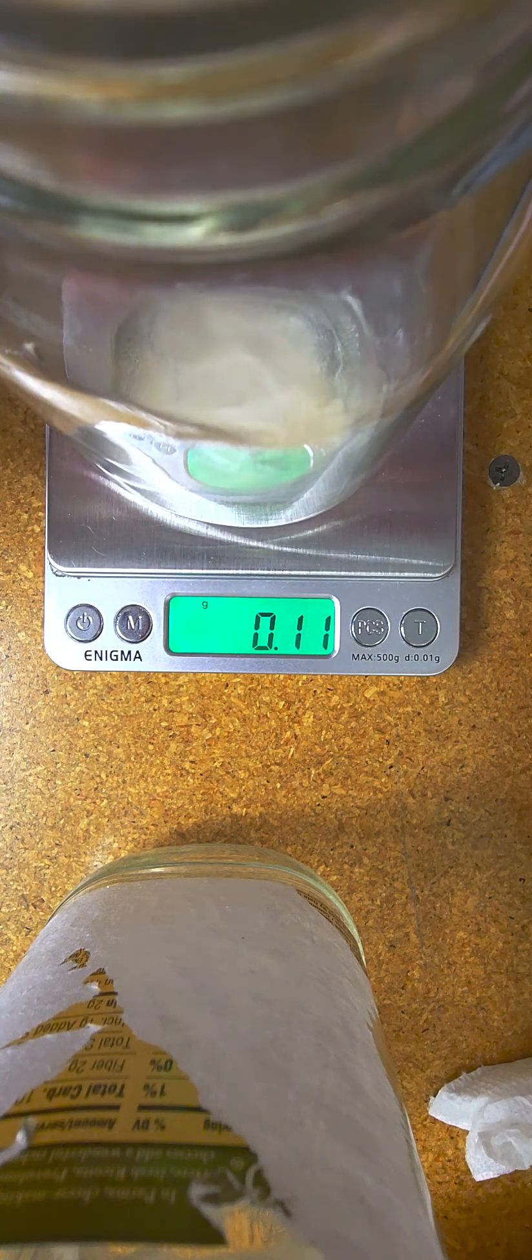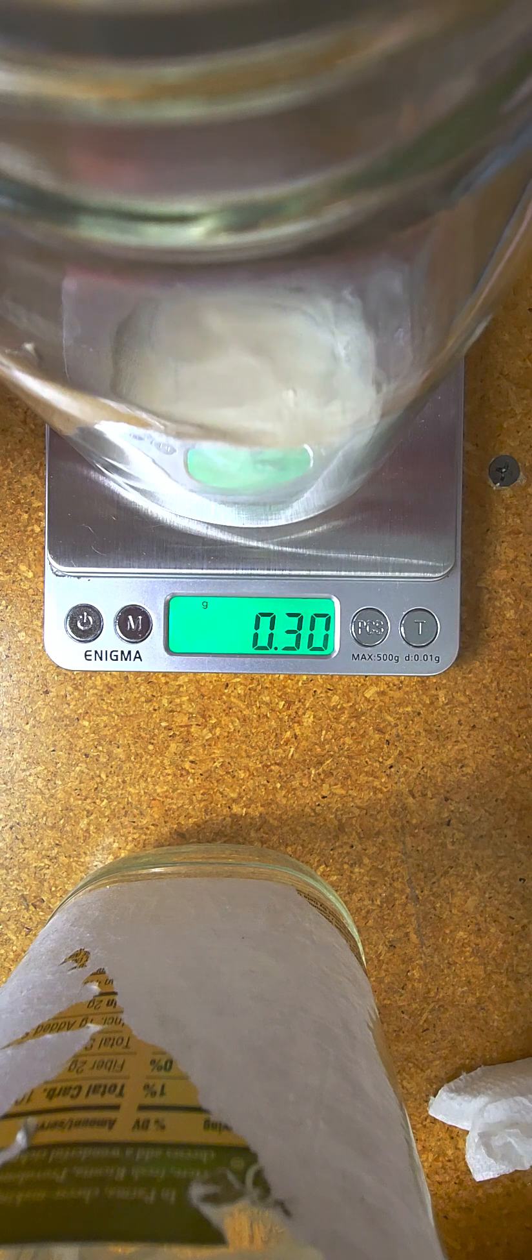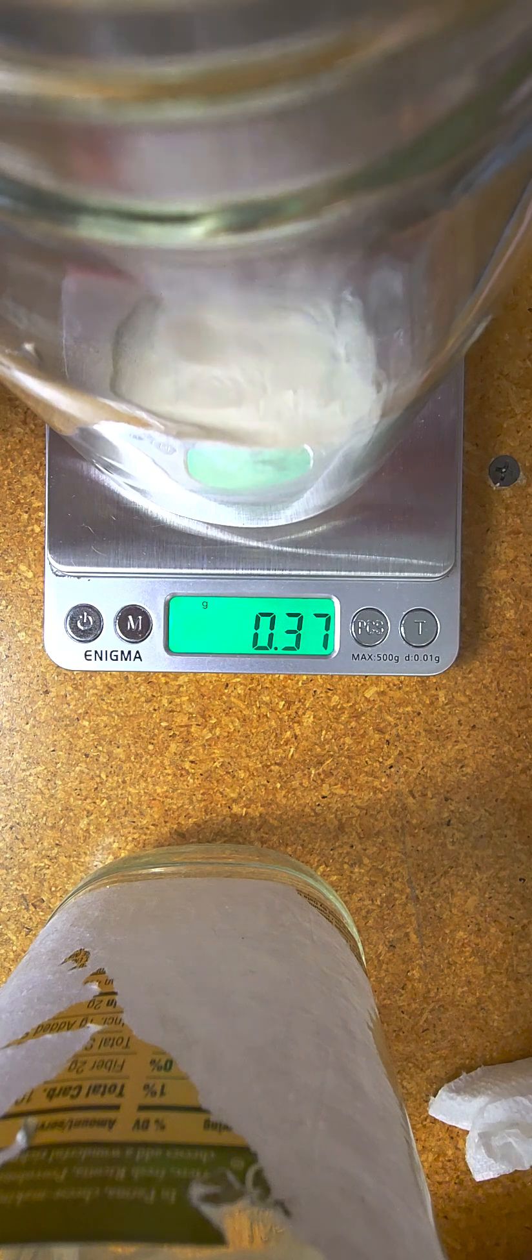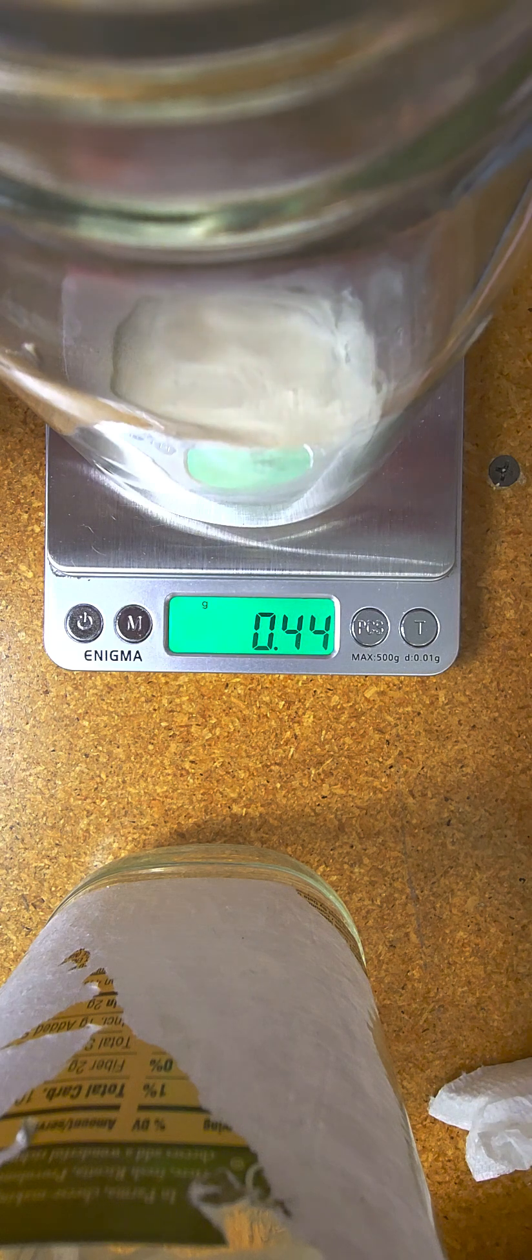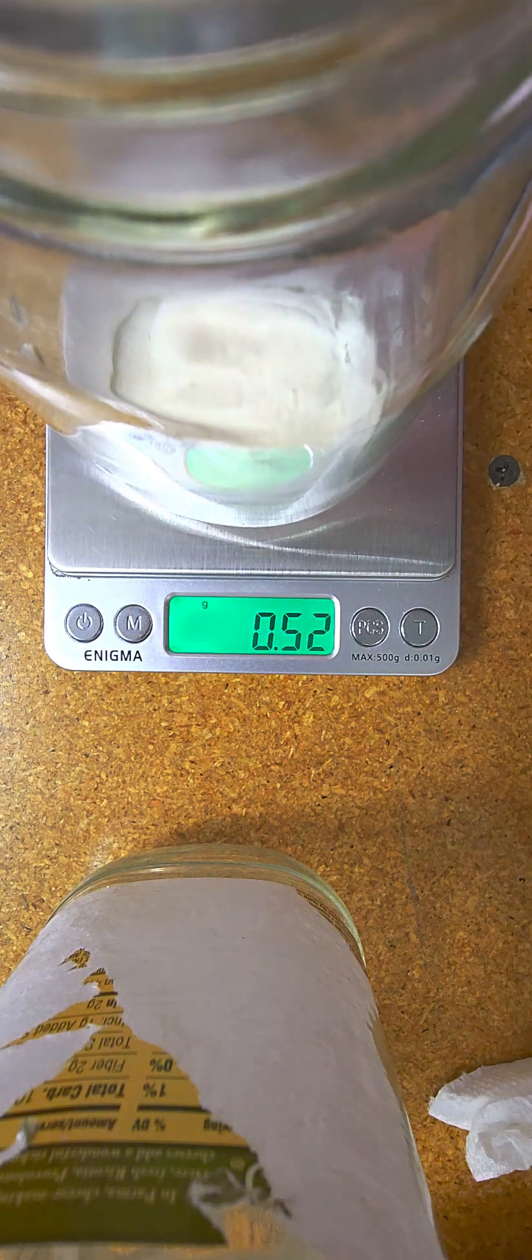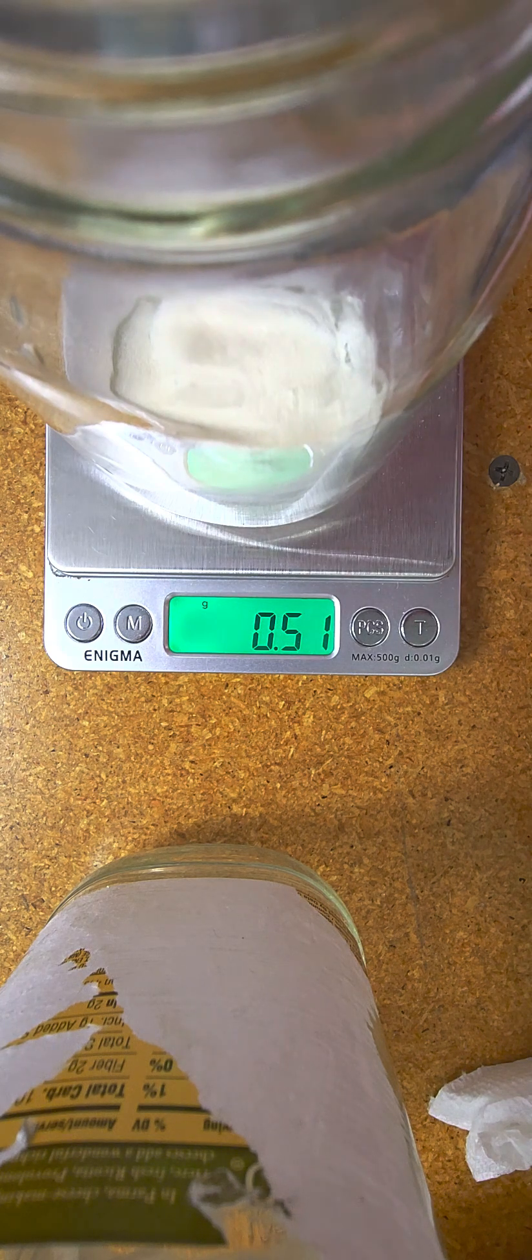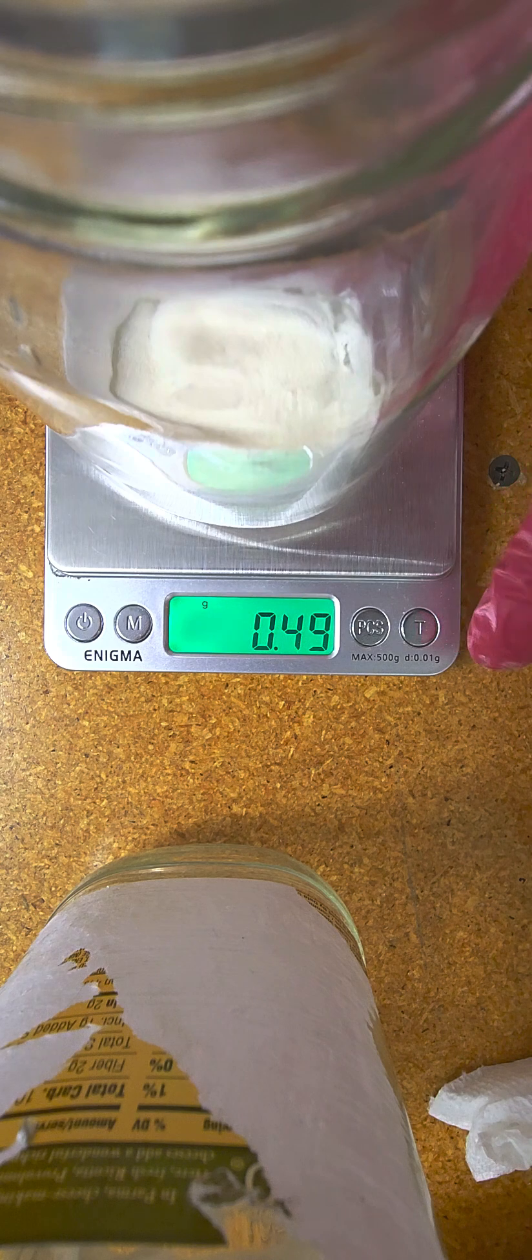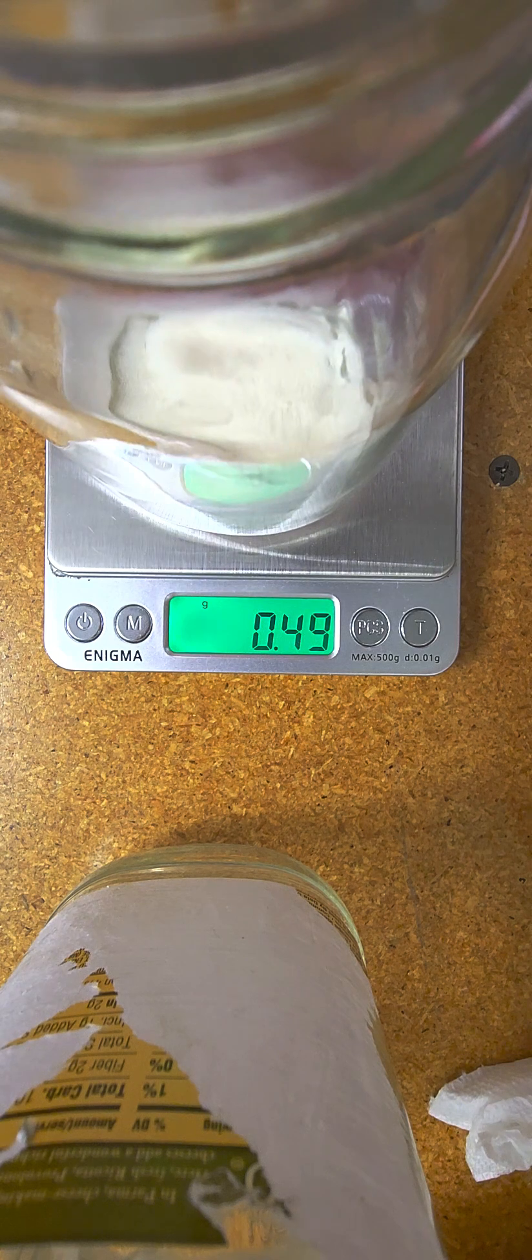And just a half gram of that. It's just because I'm moving around here and my scale is not in an awesome spot. That will be just fine. Half a gram.